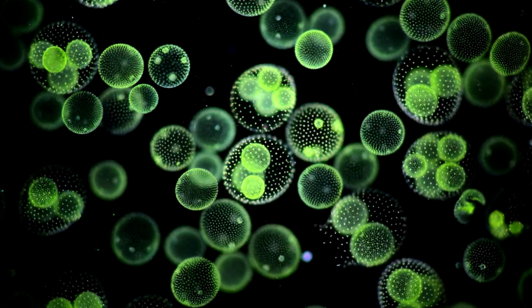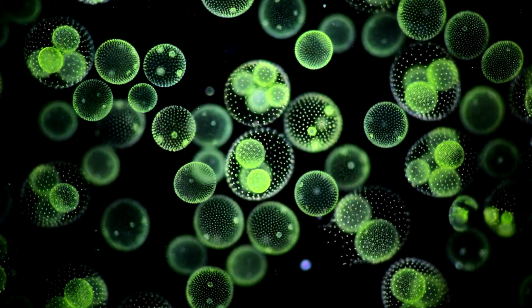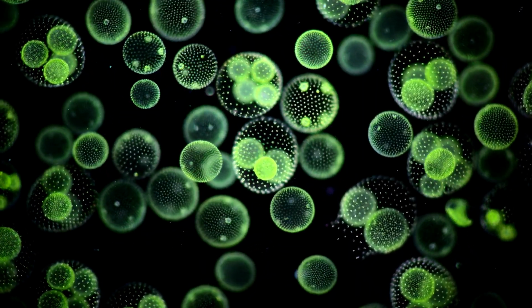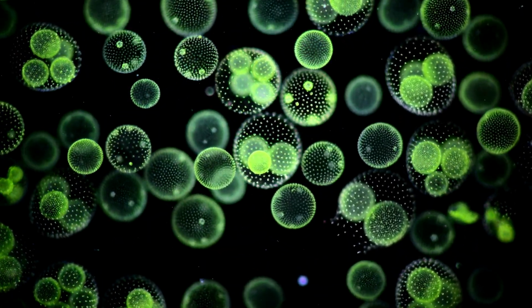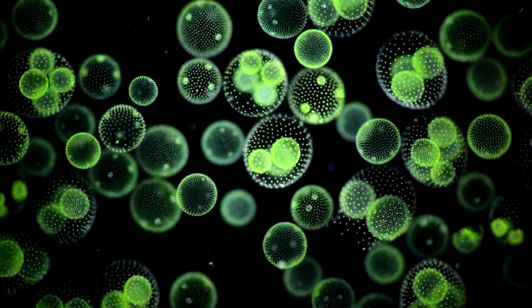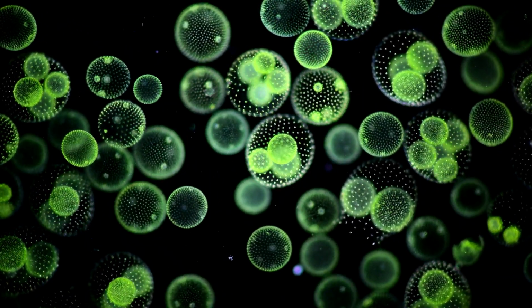Volvox is absolutely fascinating. If you have a microscope, I recommend you check it out. This is a fantastic beast. Thank you so much for watching this extremely basic introduction to Volvox, but I hope it awakened your interest for Volvox. Let's dig up some more dirt and let's stay curious.